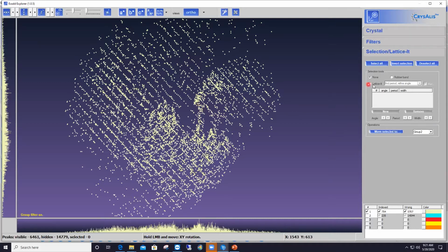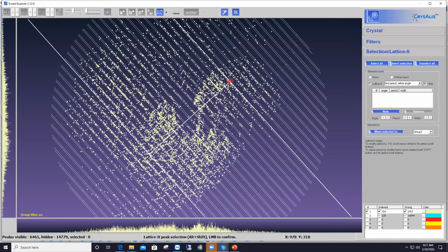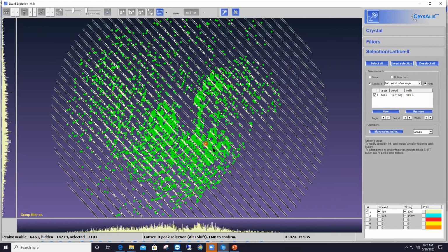So again, I check the box in front of the Lattice-It option, align my cursor with one of those rows of reflections. CrysAlisPro again sees what I see. I click once more on the left mouse, and I've got now a second batch of green reflections ready to be moved again to different groups. And here I can move that second batch of reflections into the same group or a different group. It doesn't matter. These reflections coming from ice are just junk anyway, if I may say so. So you don't care in which group you push them to.